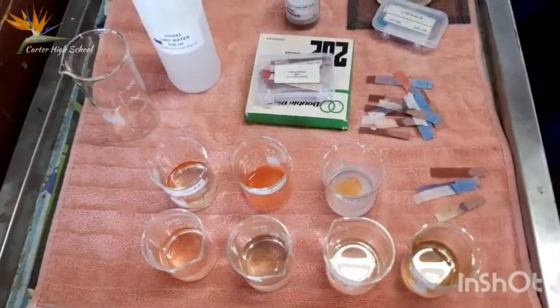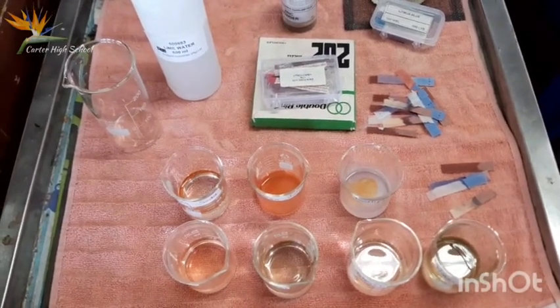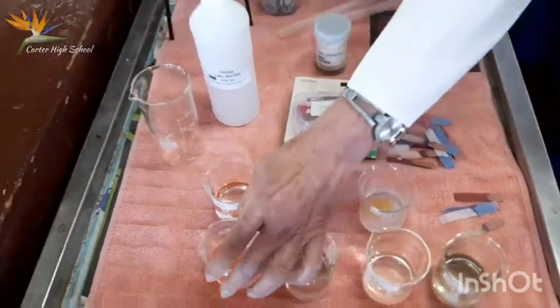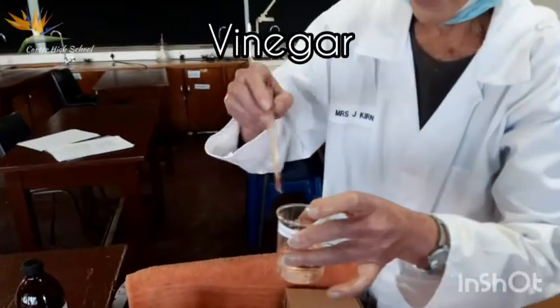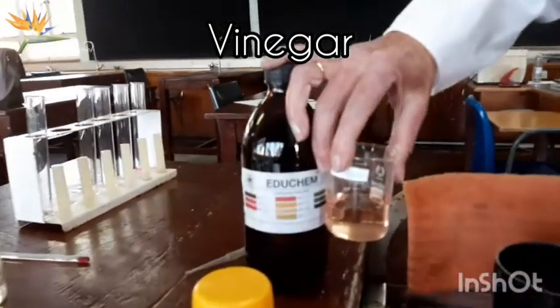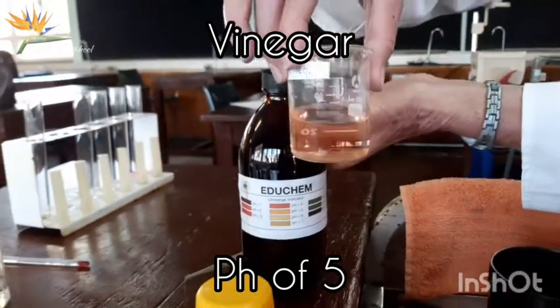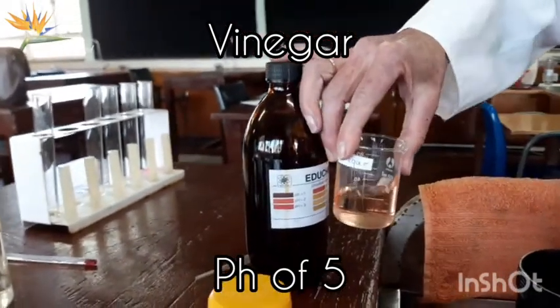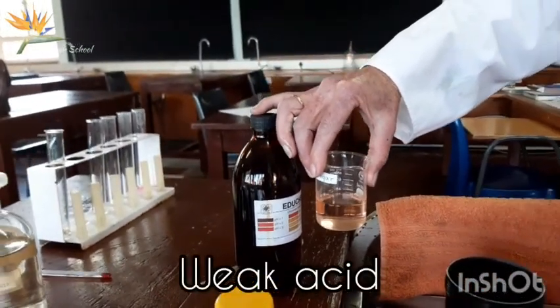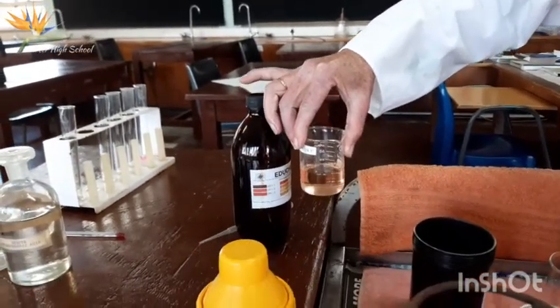Right, you can see they've changed color, but if you compare it with the chart, they either give you a chart on the bottle or a piece of paper, you can get the actual pH readings. I'm going to just stir it with this. So having a look at the vinegar, it's a very light orange, and you compare it to the colors here, and this is a pH of round about 5, okay? 4 or 5. Let's see if there's any lighter color. No. Okay, that's pretty much a pH of 5. So vinegar is what we call a weak acid, because close to 7 is neutral, and a very strong acid is 1, so 5 is a weak acid.